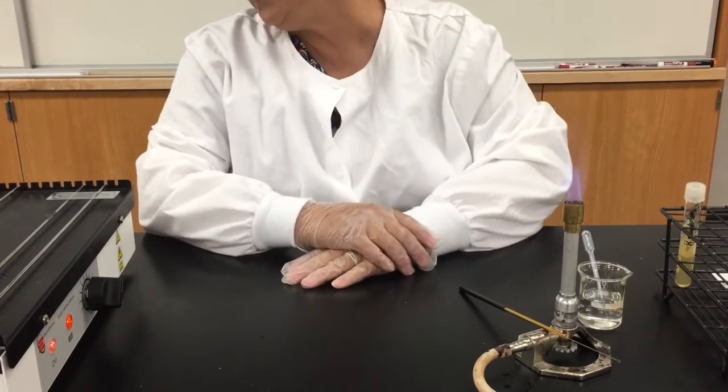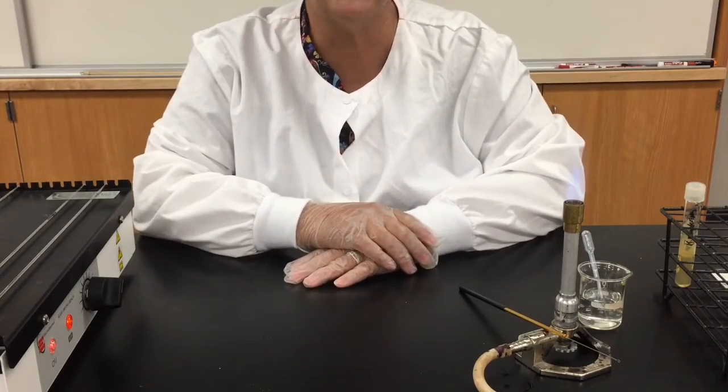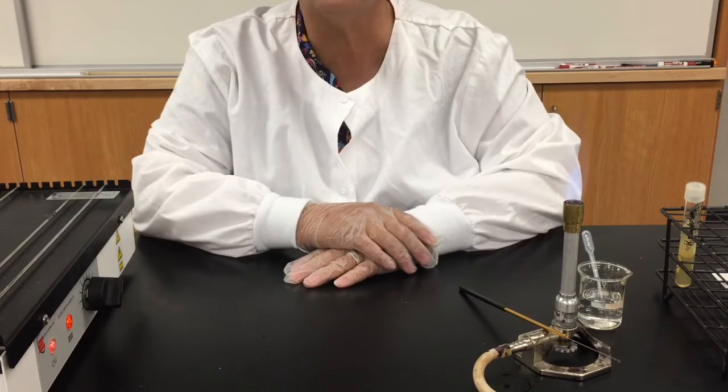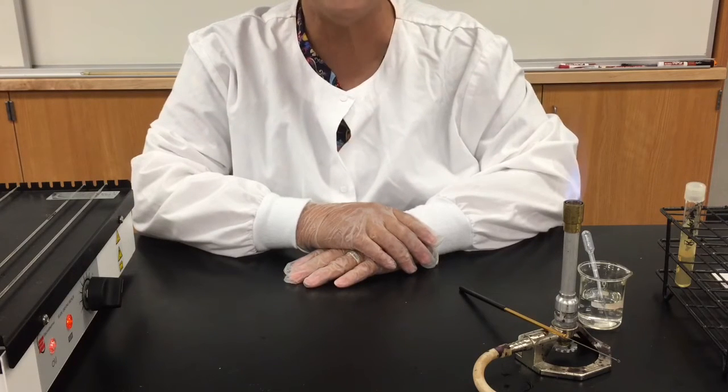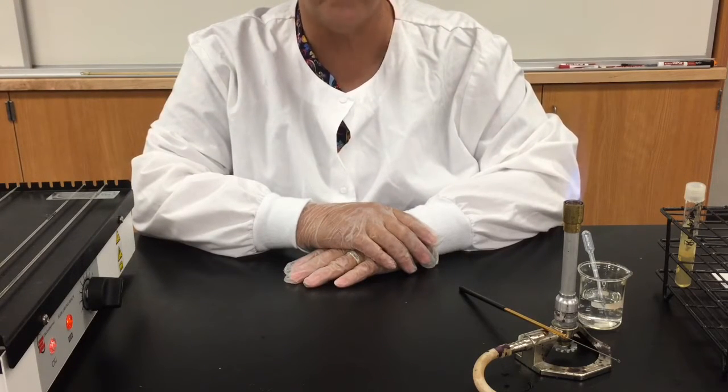All right, so it is probably going to take a good five minutes or longer for this to air dry completely, so I will be back in a couple of minutes to finish this up. Thanks.